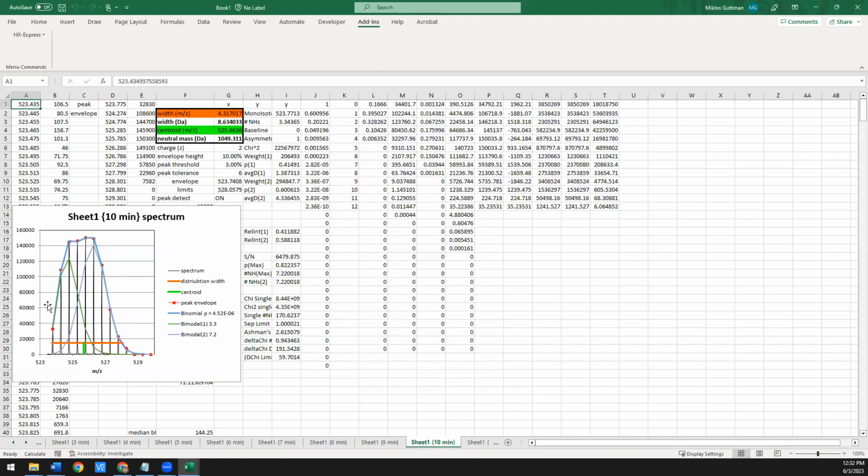Okay, so again, by eye, it looks great. It was able to fit things really well. You get a total fit that matches up with the data really well. If you look at the p-value from the f-test, again, way less than 0.05. So you have high confidence that you can justify fitting this to 2 binomials. And through that, you can say, okay, there's at least 2 populations in this spectra.